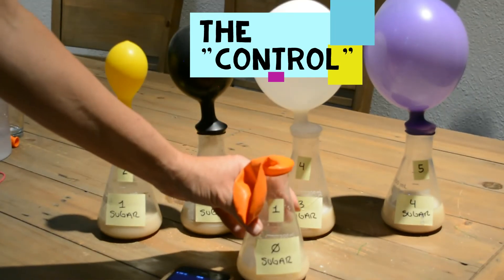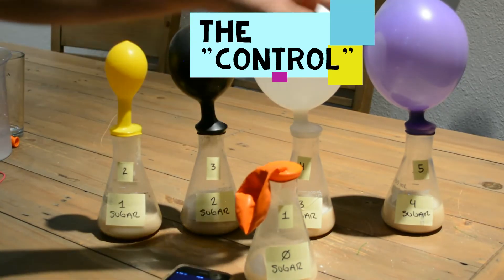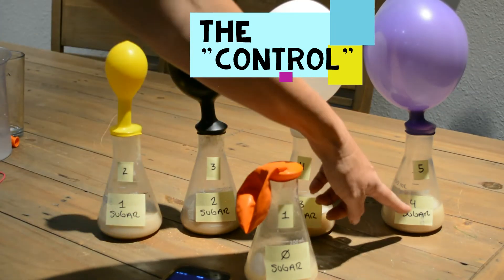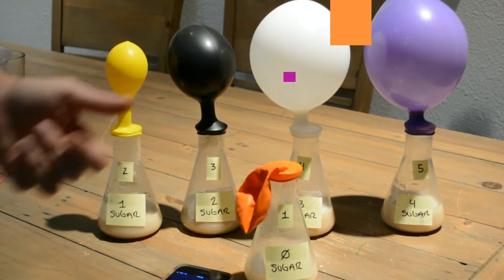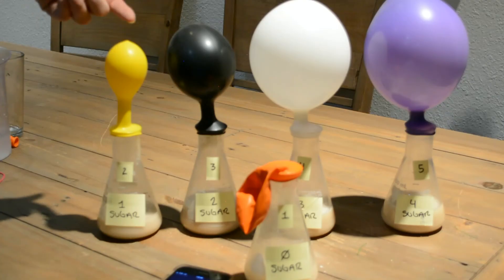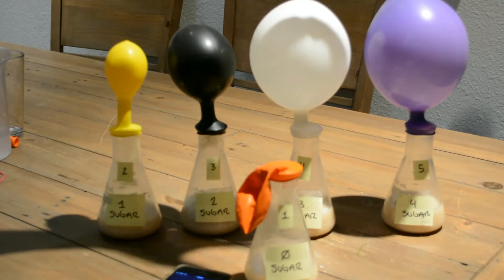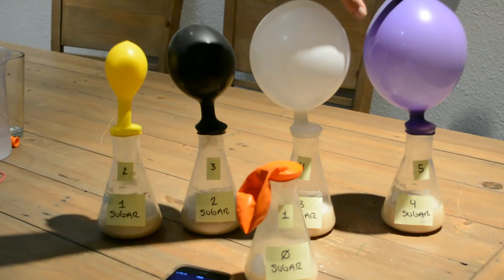We compare all the other groups back to group one. We can clearly see that depending on how much sugar you give the yeast, the yeast will keep breaking it down — more sugar means more CO2. So if you want super fluffy bread, based on our study, you'd want to add more sugar to your mixture because more CO2 creates more air bubbles in the bread, making it really fluffy.